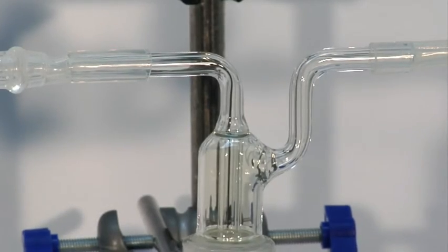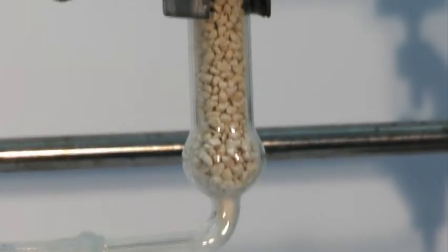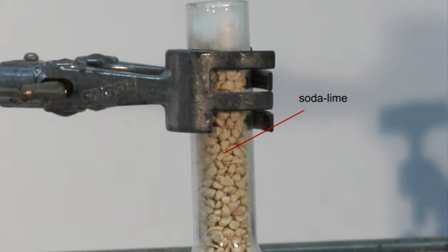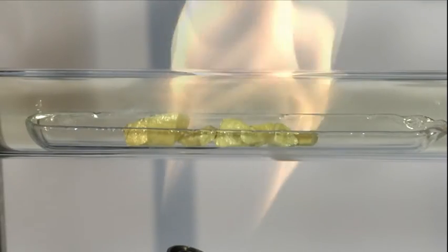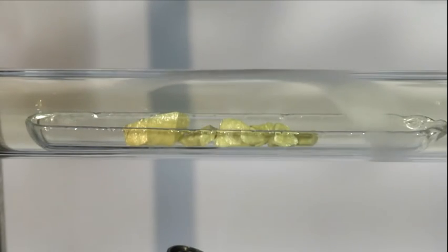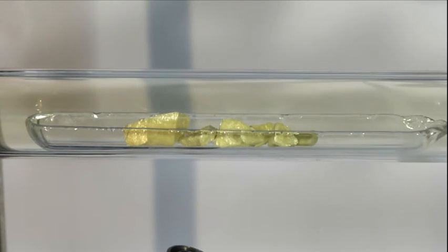This drying tube is packed with soda lime. Once a steady stream of chlorine is established, a Bunsen flame is used to melt the sulfur. Chloride products readily form and condense in the cooler regions of the apparatus.